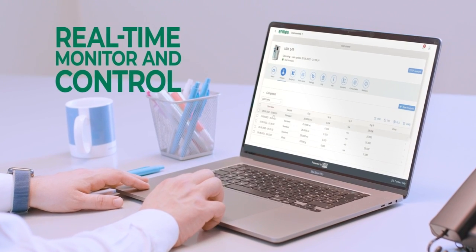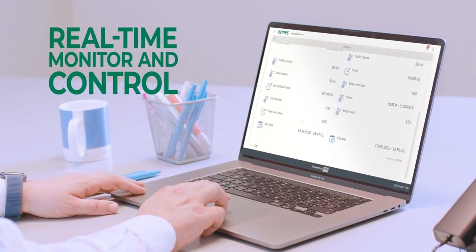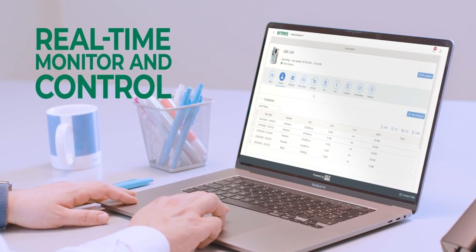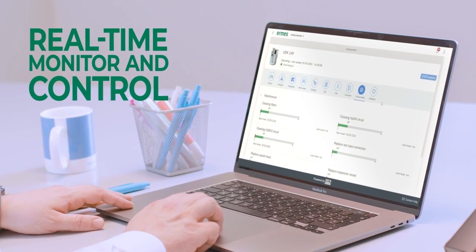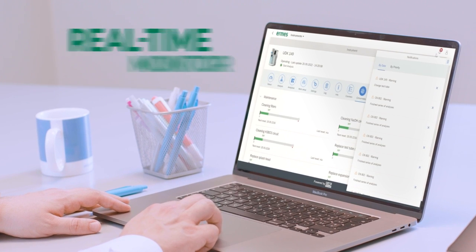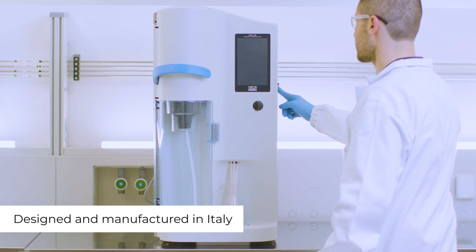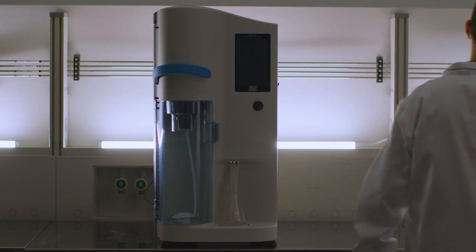Access from a PC, smartphone, or tablet to manage multiple instruments, analysis data, and instrument working conditions, receiving immediate event and alarm notifications. VELP UDK 149, the versatile Kjeldahl distillation unit designed just for you.